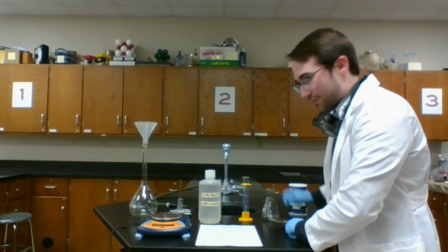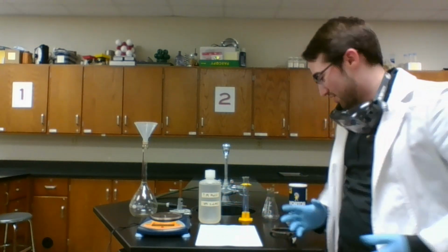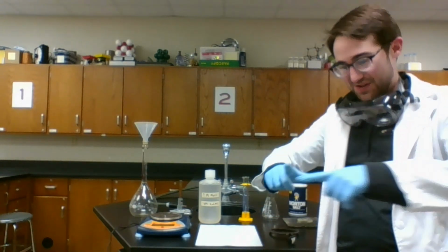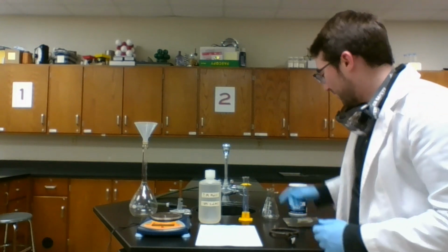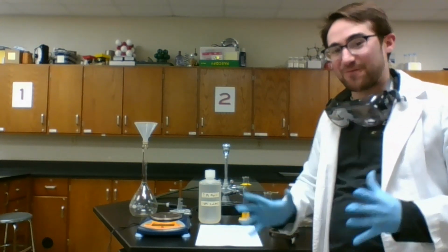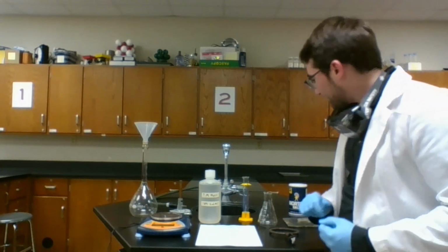This is not the only way that you can do this. You can, of course, use a hot plate. You could use a different setup rather than a ring. Some stands have a kind of triangle that you can place things on. We don't even have to use an Erlenmeyer flask. But in this case, it fits our experiment best to be safe and practical and efficient.